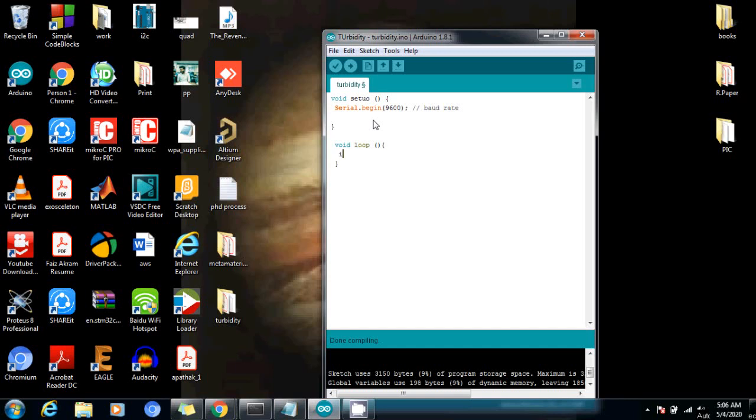We need to initialize an integer. I am going to write turbidity and we need to read the analog value. As I have already mentioned, I have connected the turbidity sensor to the A0 pin, A0, and now I need to convert this analog signal into the digital form.